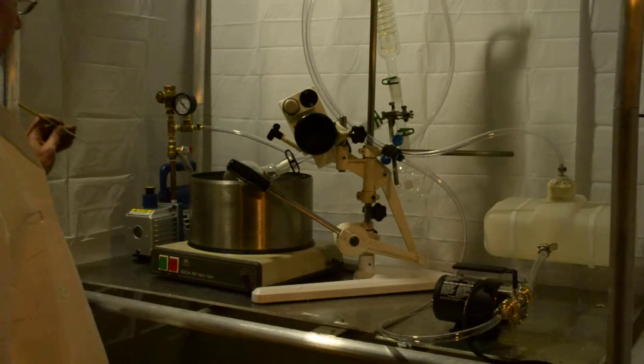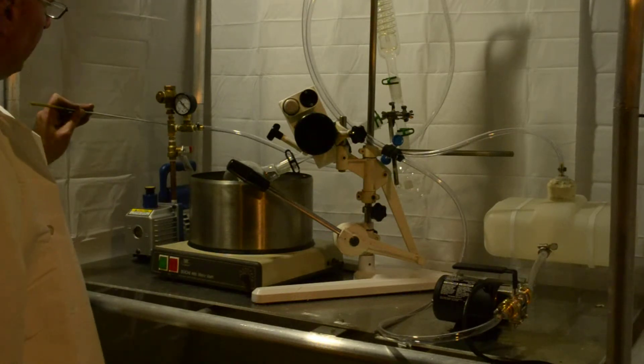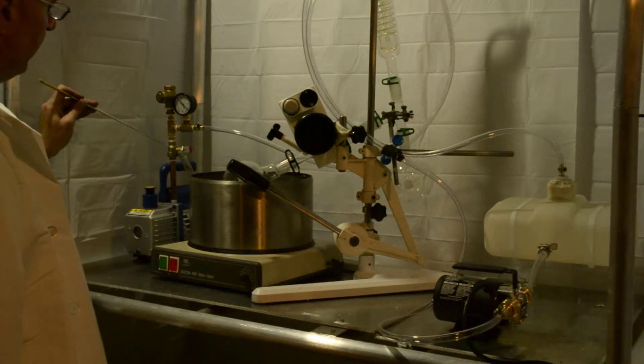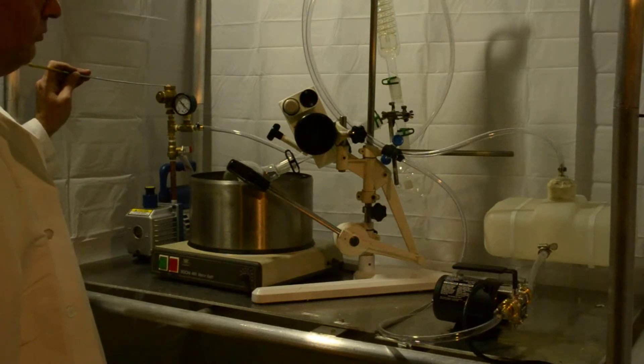Then you've got your vacuum pump, this will be all assembled. This is your bypass in case you have your switch on off, so you want to hold your vacuum and the pump's still going. It'll suck through here. It's like a check valve or like an automatic vacuum pump would work.